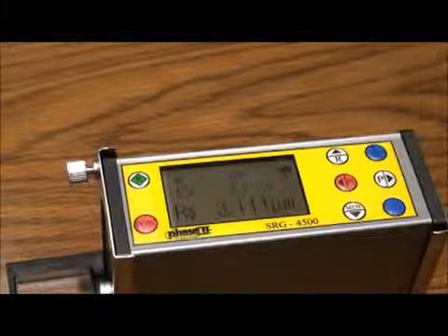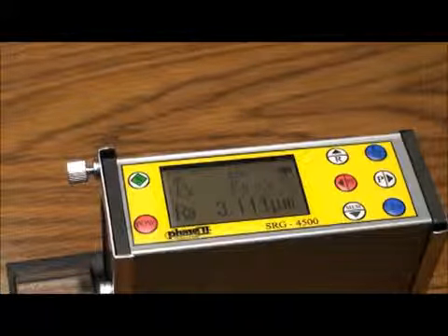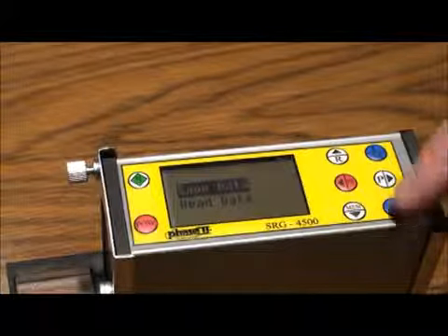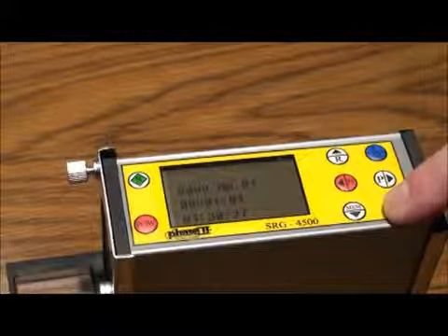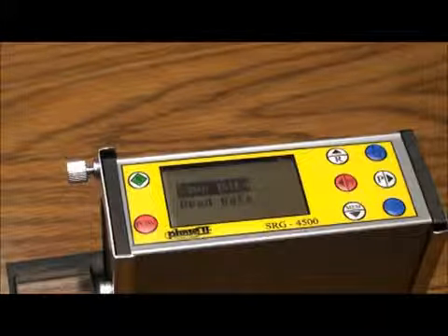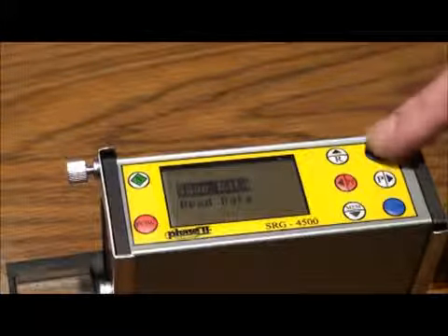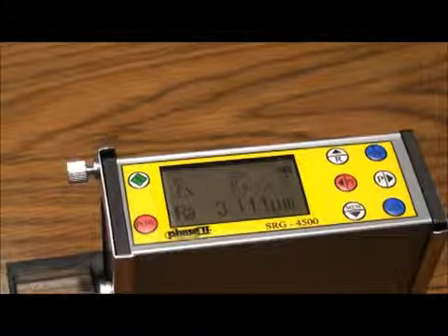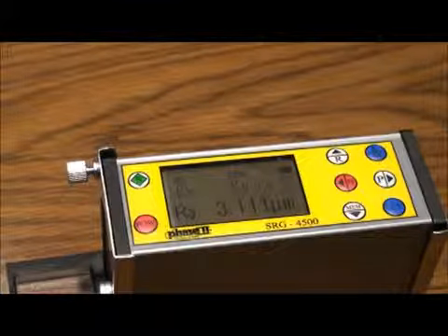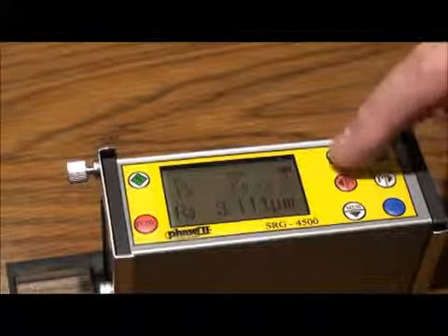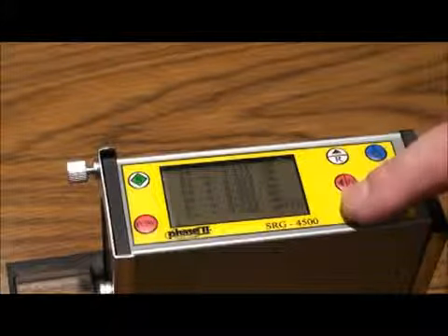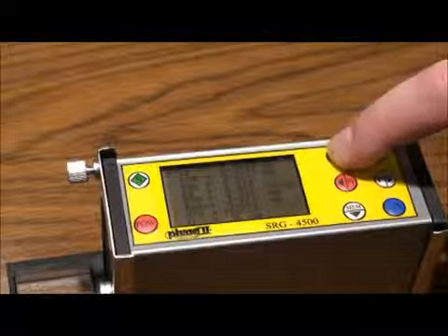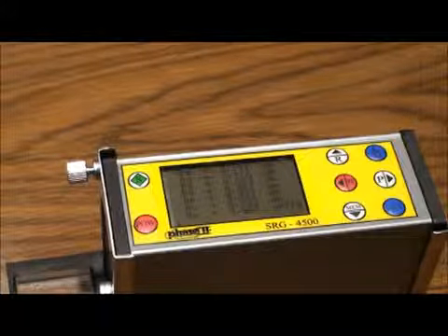To exit, press the LM button, taking you back to the main measuring screen. To view data in other parameters, press the R button and use arrows to scroll. Press the LM button to exit.